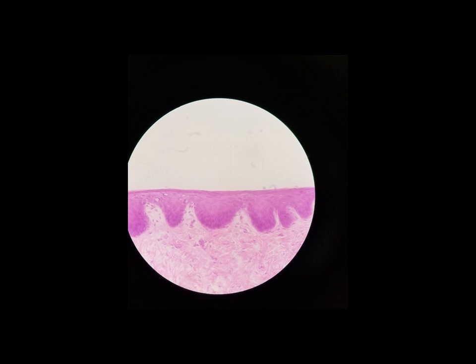Now, there is a part of this that doesn't really look completely flat, and that's deeper down here. And really, these are cuboidal cells, and they're special. They're stem cells that are actually dividing to produce all of these cells at the top. So really, the cells at the top, that is the stratified squamous epithelium. And those cells are either dead or dying off. And that's what we want. It's not a bad thing that they're dead or dying, because the purpose of this tissue is abrasion resistance.